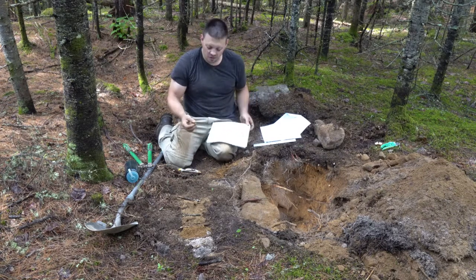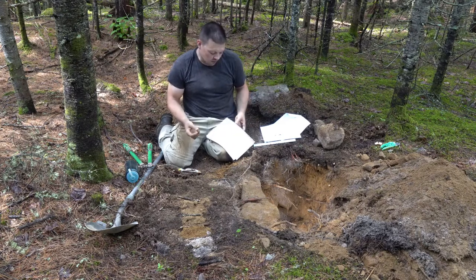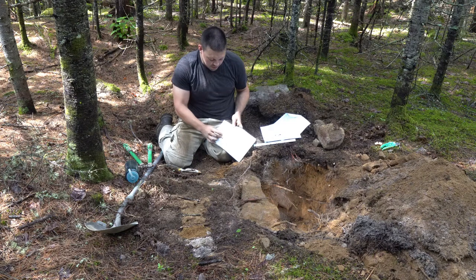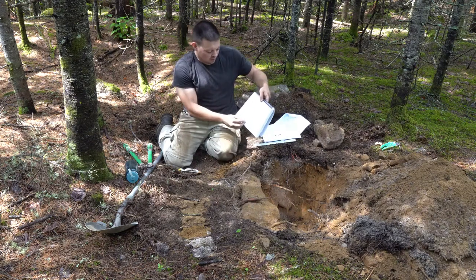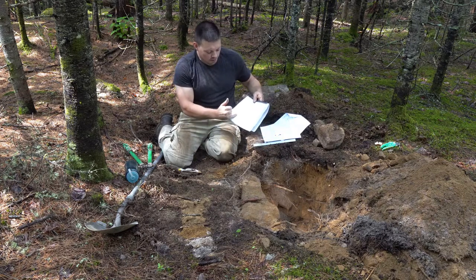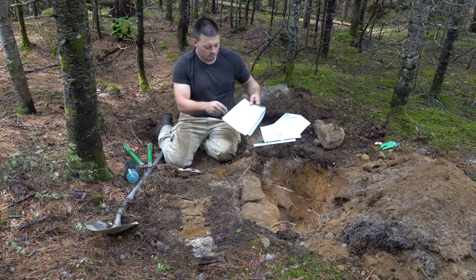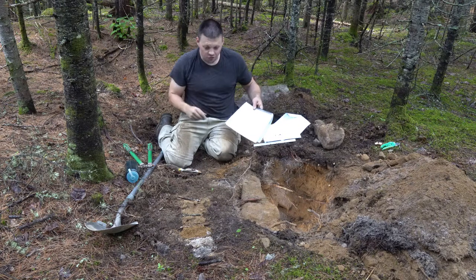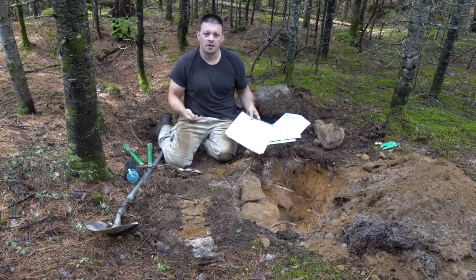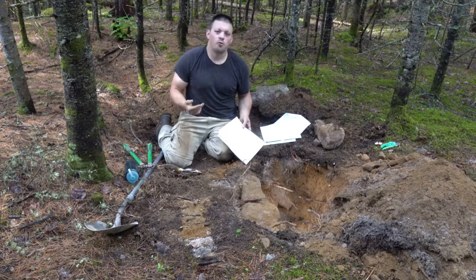Is it sharp edges? Well, it's quite rounded, so we know we're dealing with a subangular blocky structure. And we hold it up to determine the size. So you simply hold it to, see, it just fell apart, so it's quite weak. But based on the size of it, I would put it in the fine to medium. So our structure for our BF would be a weak, fine to medium subangular blocky structure. So it's pretty straightforward in how to fill these out.